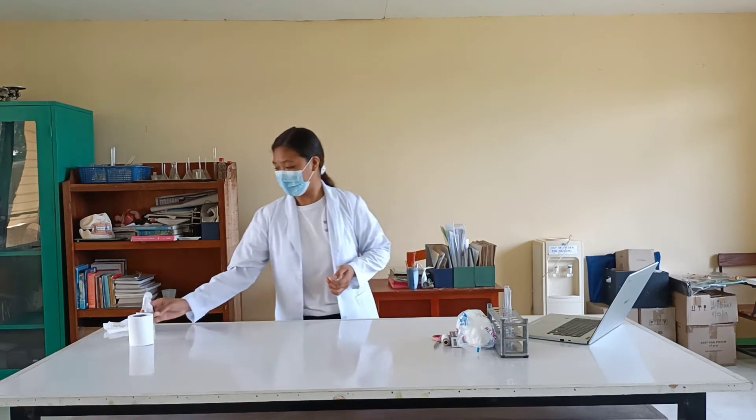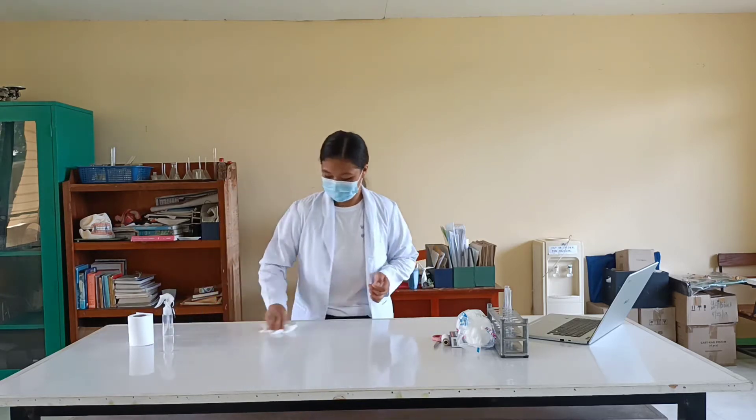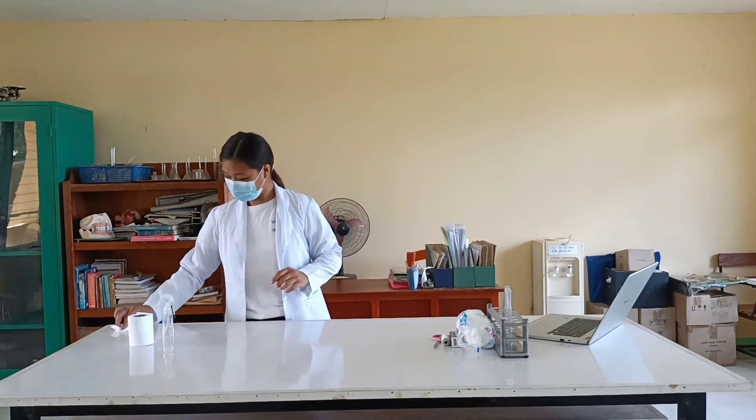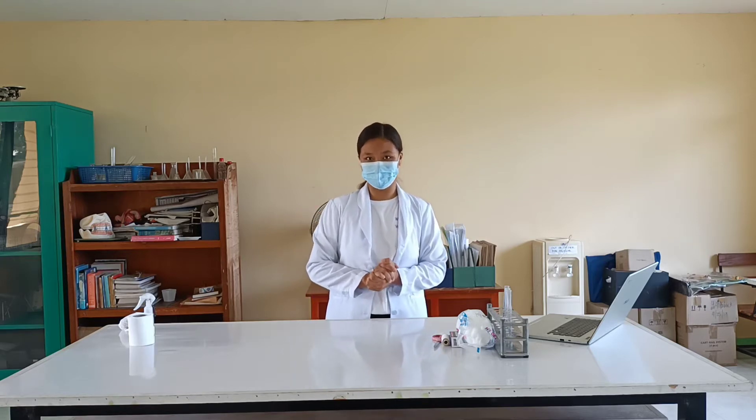But first, we need to disinfect the area where we will be doing the activities. Then next, we will now gather all the things we need.